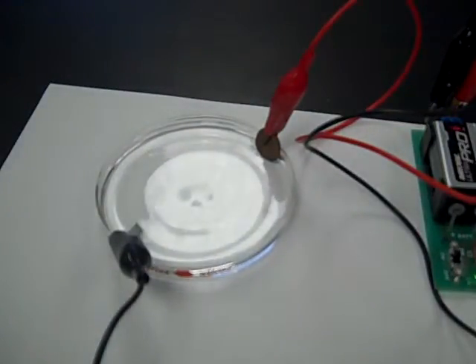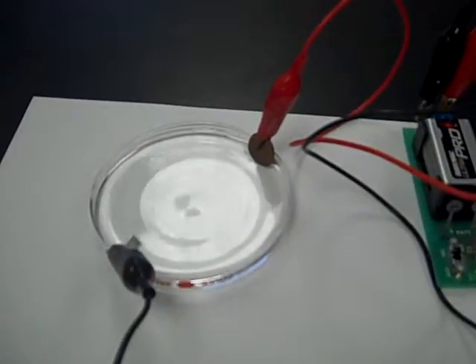Now if the electroplating goes on for a while, for at least 10-15 minutes, the final result will be the copper penny covered with a grayish layer of zinc.